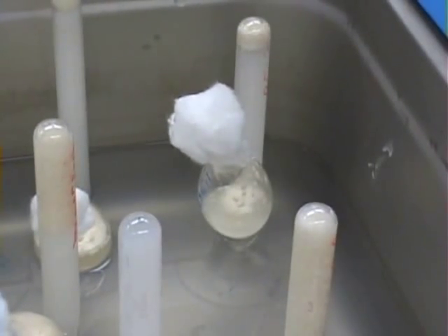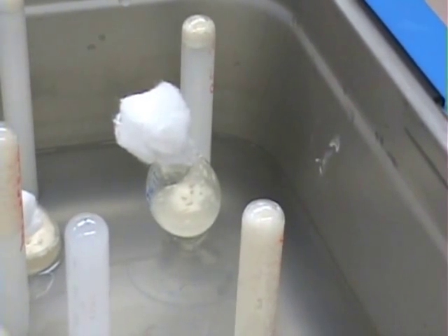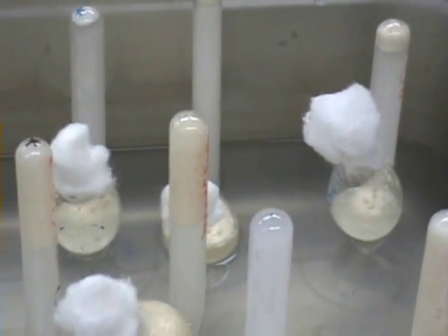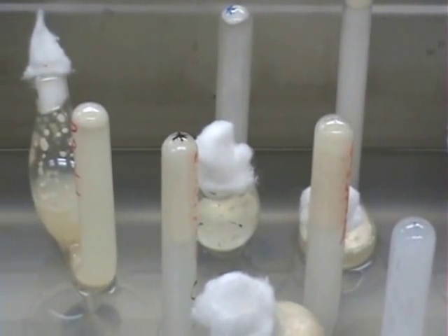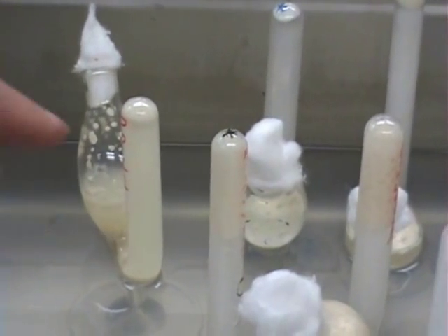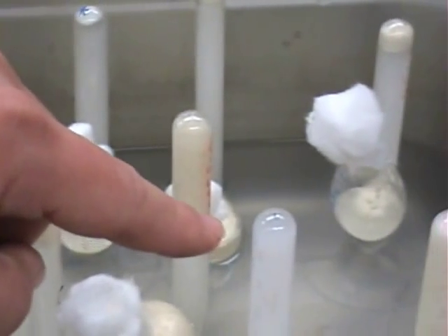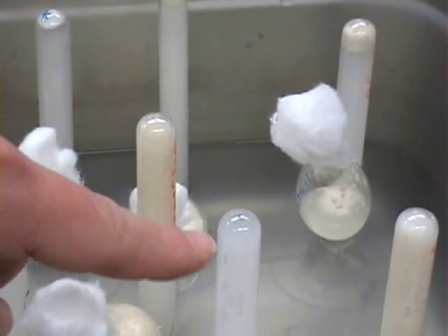At the 20-minute mark, we have bubbles and gas in many of the tubes. Some of them have none still, and others have lots of gas. You can tell by the amount of bubbles — there's a little bit here, and over here there's very little or none.